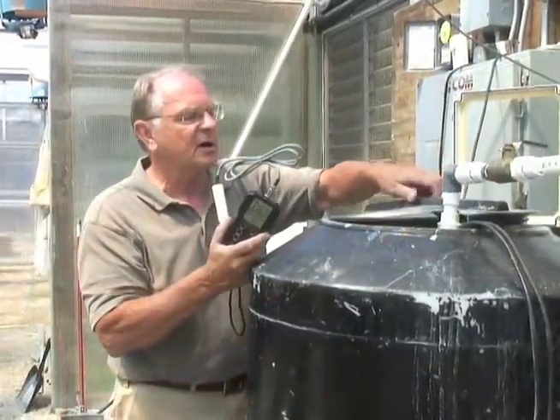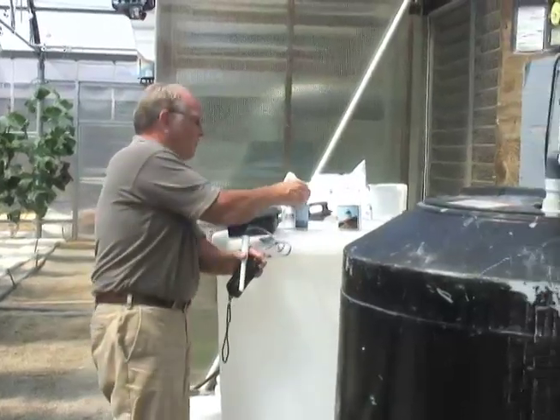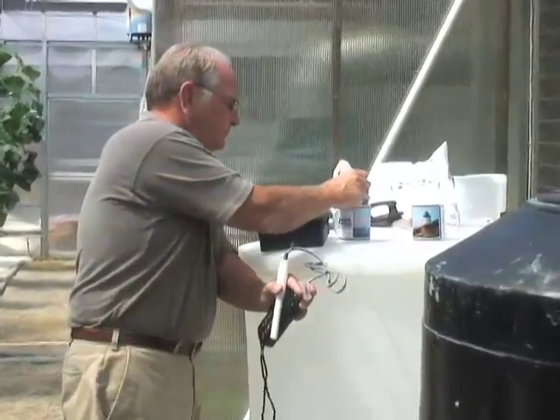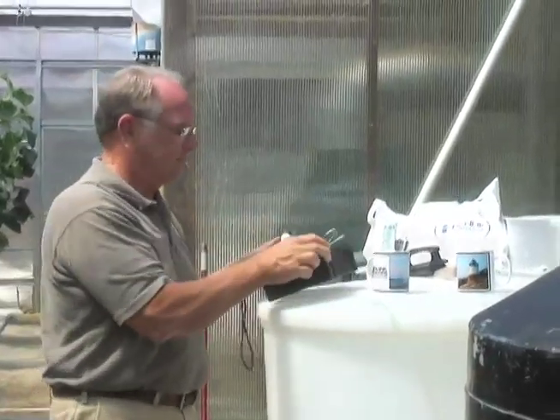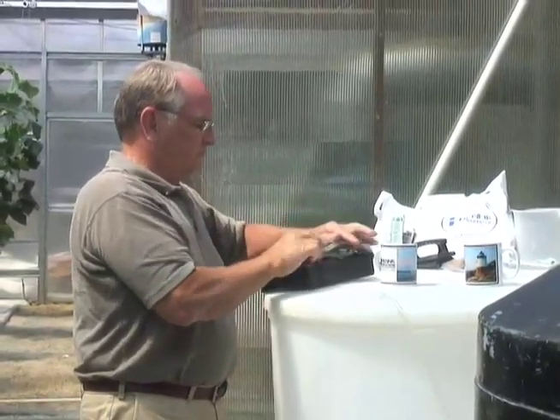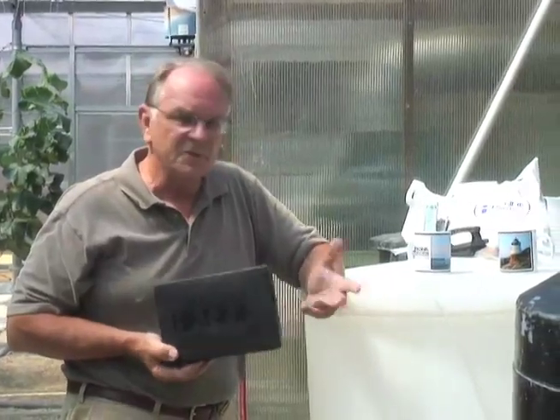To store the 9813, it's very easy. We make sure there's some liquid in the little cap — I'm going to use the pH 7 solution and put a couple drops in. Secure the cap, and now we're stored. You can store it for as long as a year.